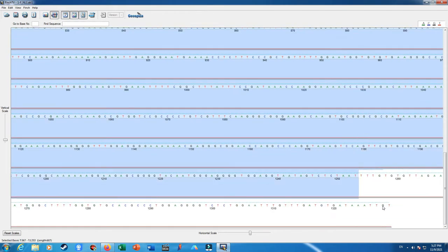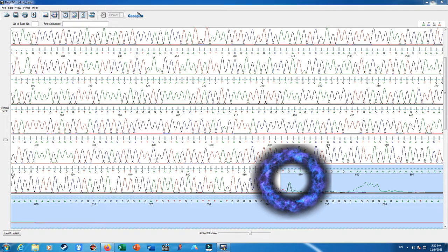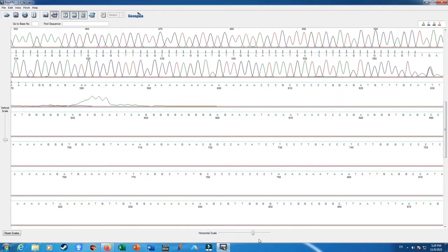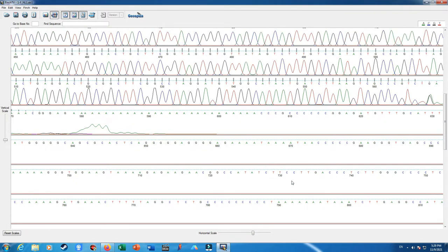I just select and delete. At the right of what I highlighted in blue, you will see that some of the sequencing data, like guanine and thymine here, are overlapped with each other due to the low amount of the fluorescent dyes and overlapping of nucleotides in this region.